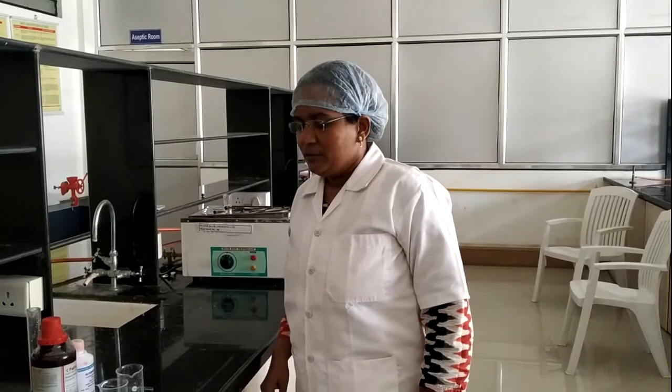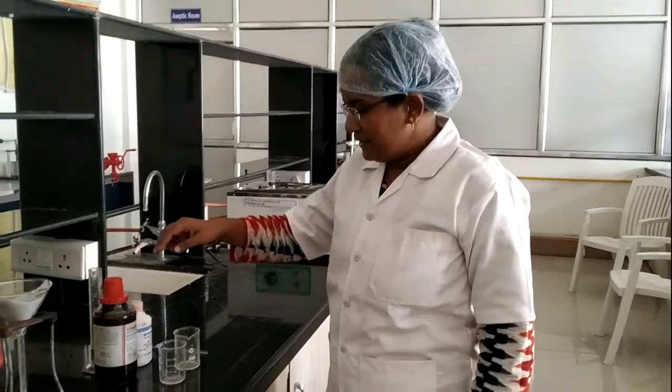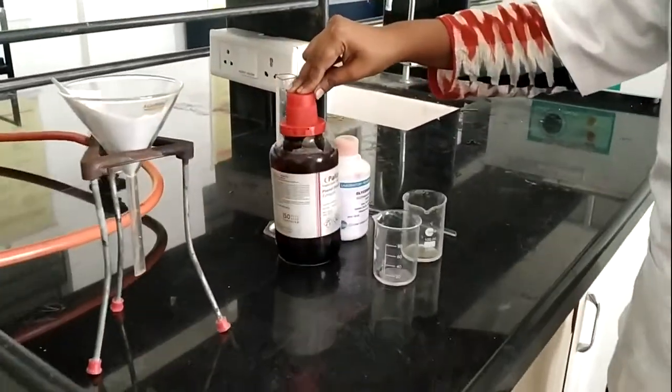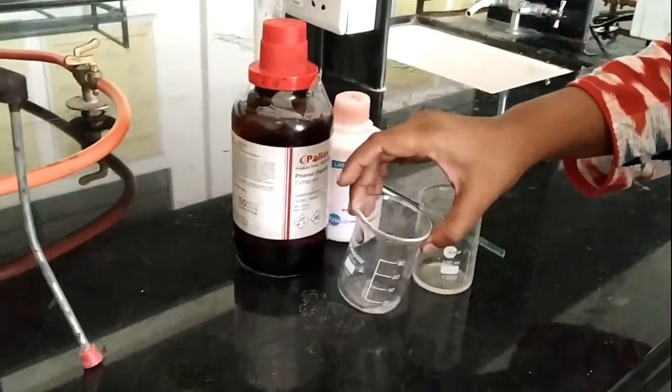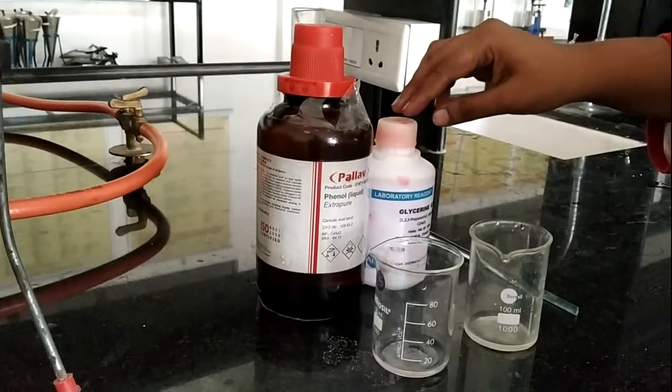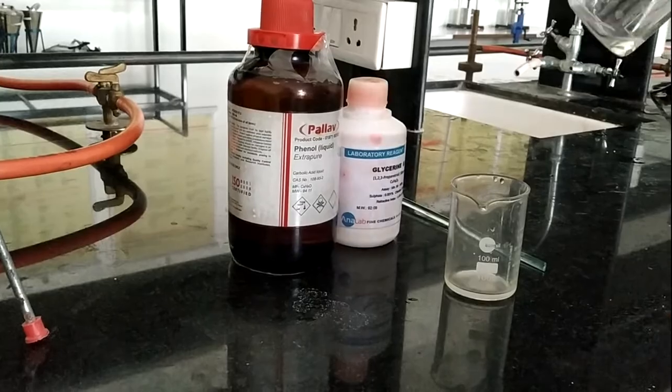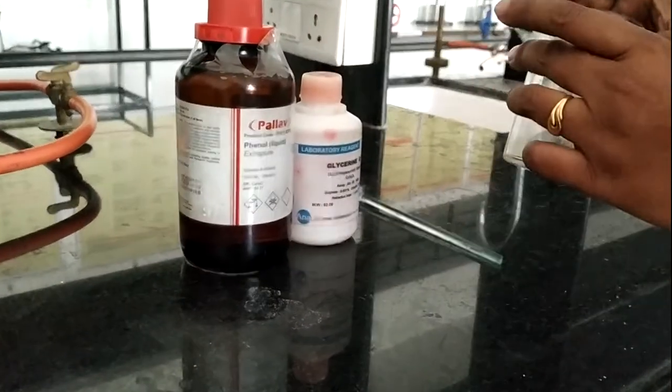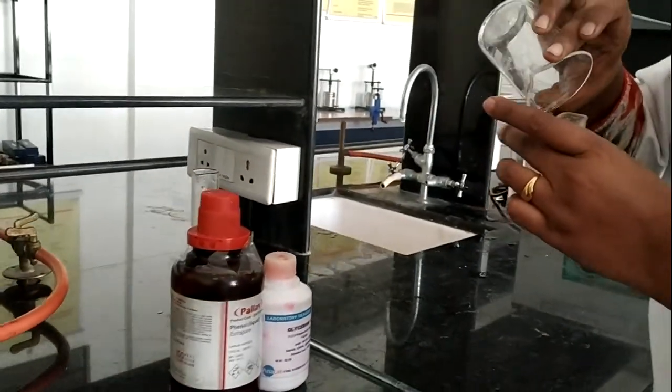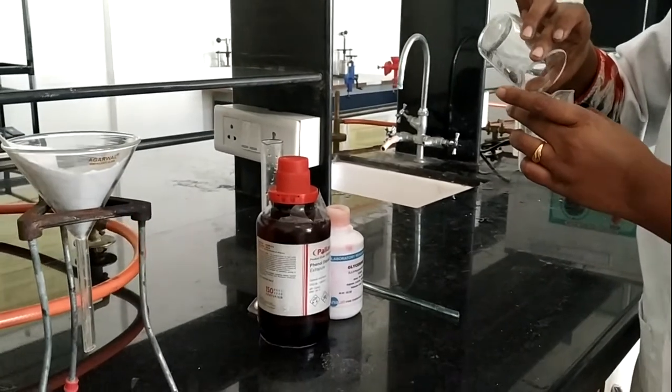Now let's move for performing the actual practical in the laboratory. We have this liquefied phenol taken in this beaker and this is glycerine also taken. First, we are going to add this phenol into this glycerine and mix it properly.